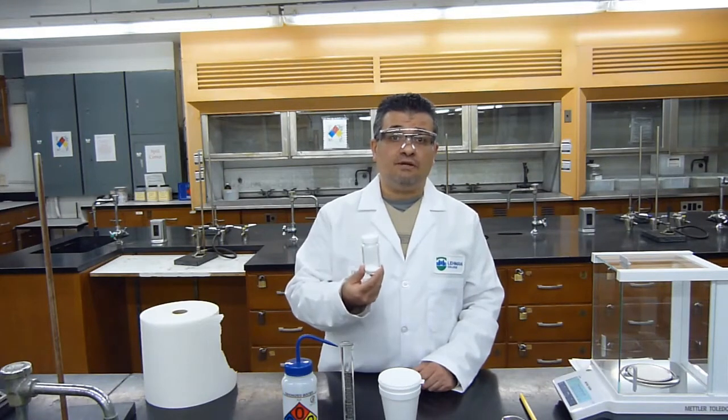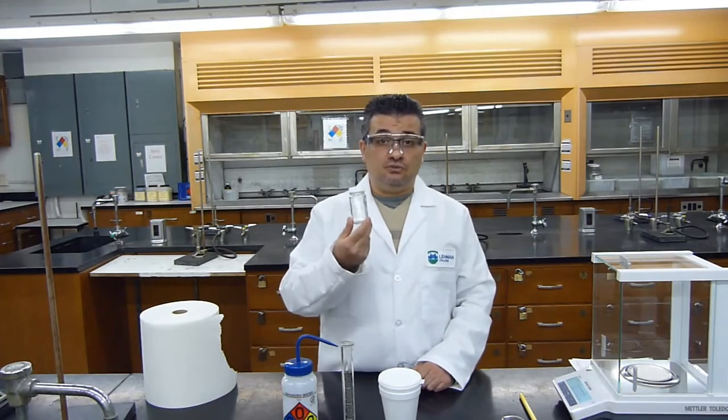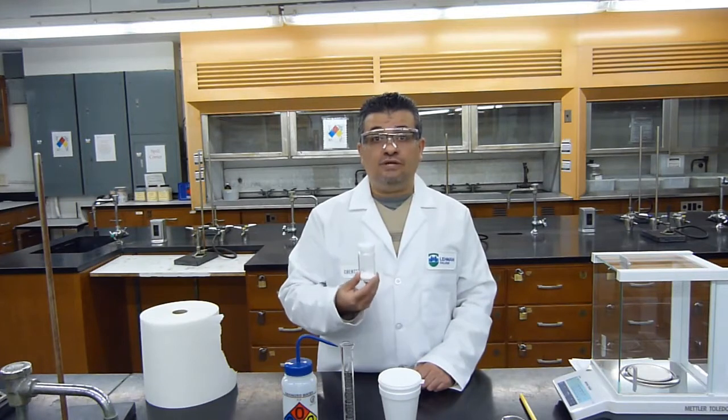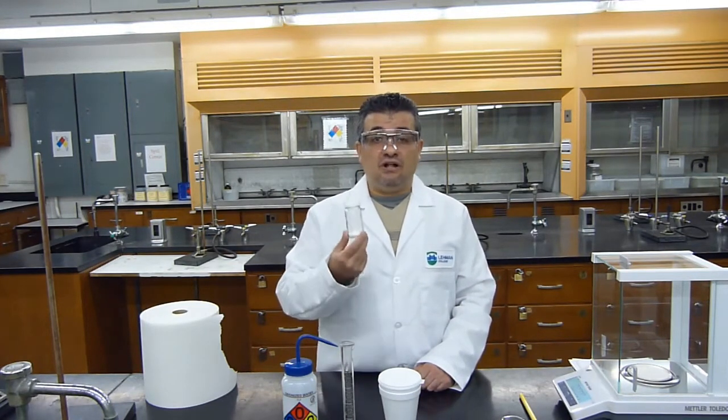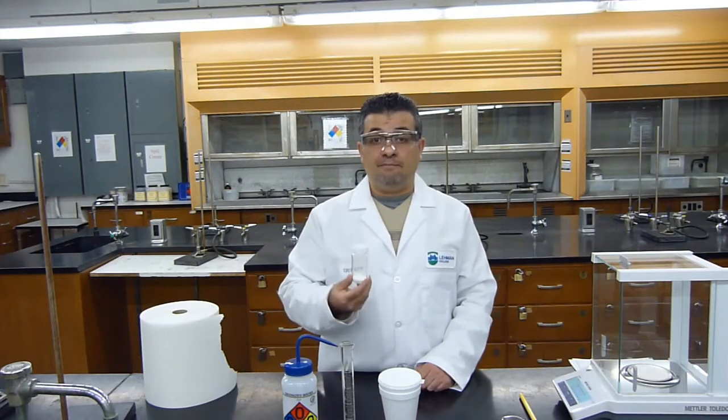If dissolving the solid in water is an endothermic process, it means it requires energy, it will obtain the energy to dissolve from the water molecules surrounding it, and I will notice that there will be a decrease in the temperature of water. If the dissolving is an exothermic process, the reverse will happen. It will give off energy as it's dissolving, and the energy will be absorbed by the water molecules, and this will increase the temperature of water.